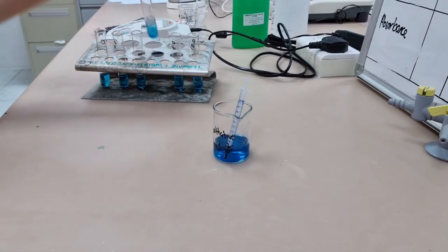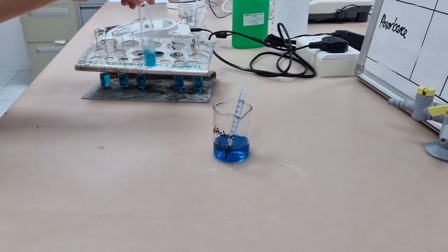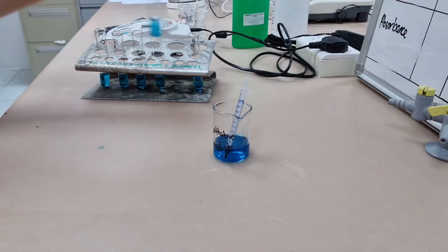You need to add one mil of Benedict's solution instead of the prescribed two mils and you need to place it in boiling water for three minutes only, not five minutes as prescribed by AQA Practical.